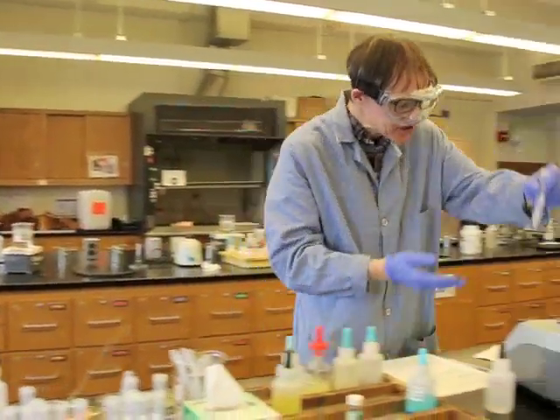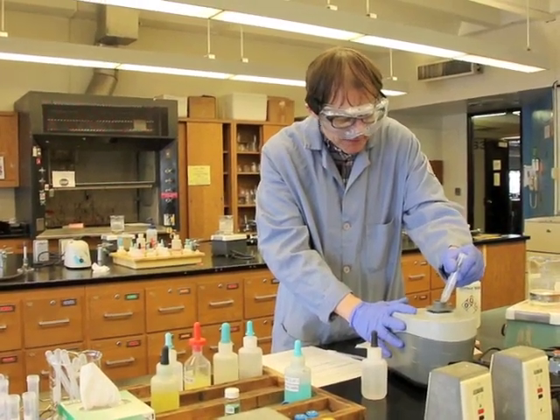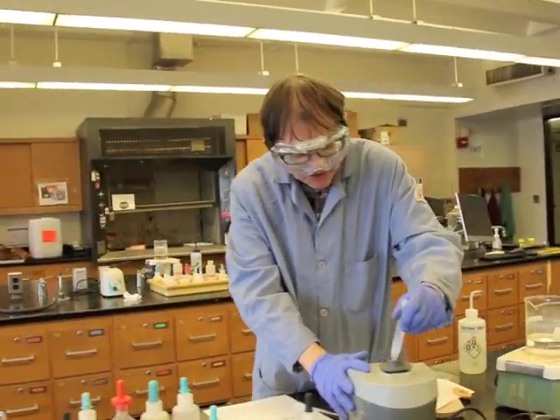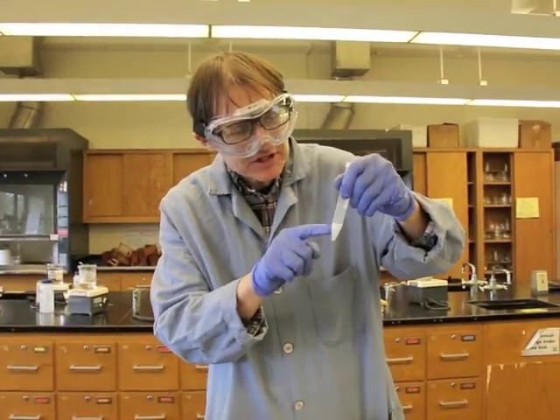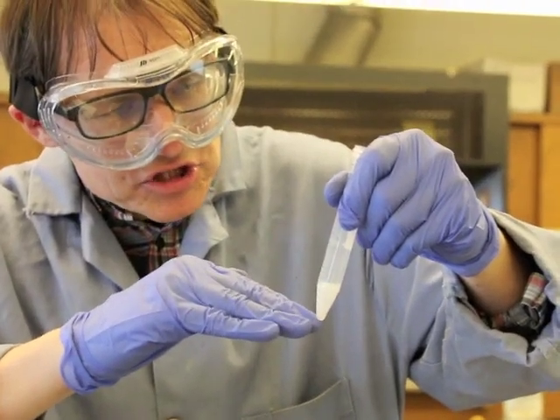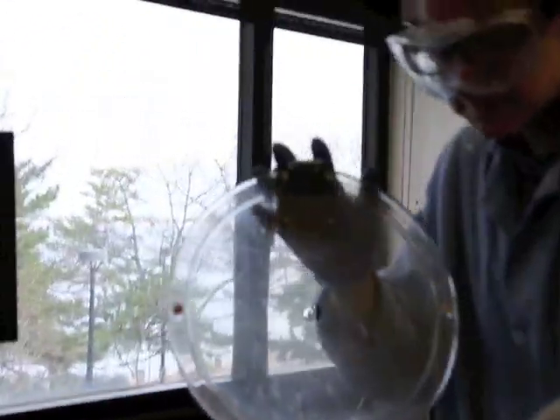Now we'll go ahead and mix the solid in there. What we're doing in this process is we're trying to make sure that solid doesn't have any contamination. The contaminants for this experiment, in this step, are copper and silver. So we just want to make sure that any copper and silver that's in there goes into the supernatant. So the bismuth should be forming a solid, so it should go down to the bottom as a precipitate. So now we're going to separate this again via centrifugation. Do this just for a couple of minutes, and we'll check and see whether we've got a pure sample.